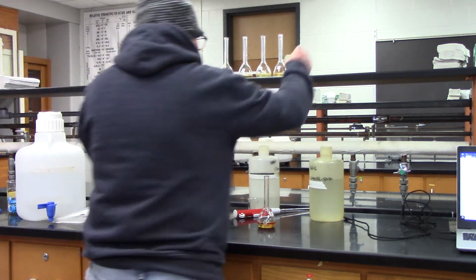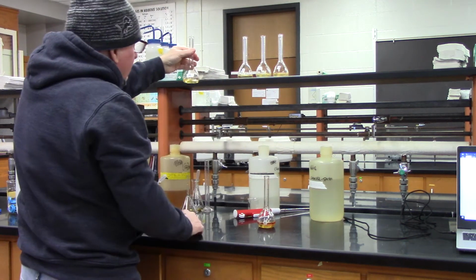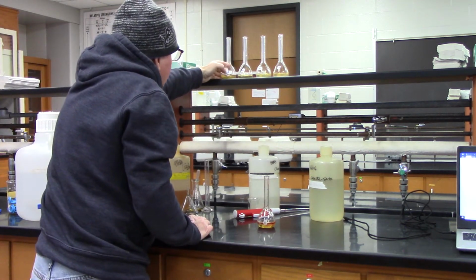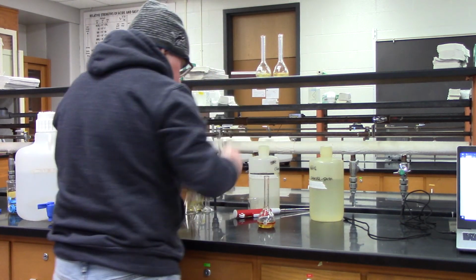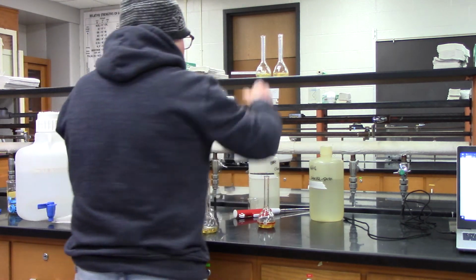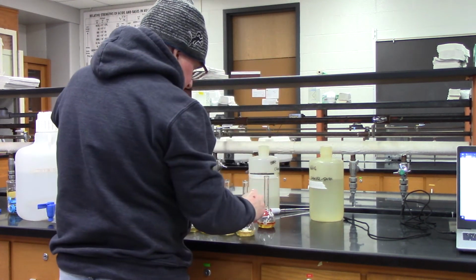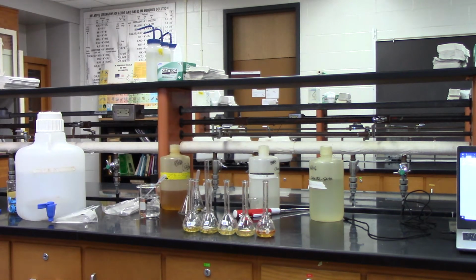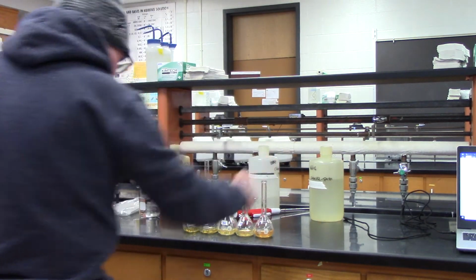All right. Okay, now to each one of them I have to raise them up to 100 mils. Now, if we take a look at them, you can see, maybe you can see the differences.